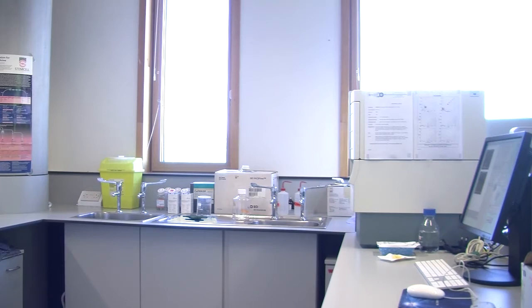So what we have is an antibody. If, say, our OCT4 is a mouse antibody, and it's an IgG1, then we will have another mouse IgG1 that doesn't bind to anything on human cells. So it has no binding at all to human cells whatsoever. But it's still a mouse IgG1, and we put the same fluorochrome as the OCT4 antibody. So that's our isotype matched control. It's the same isotype, same animal, same fluorochrome as our actual antibody.